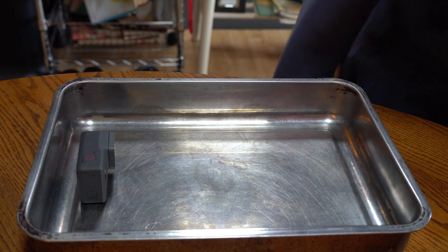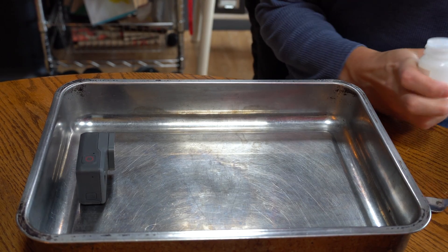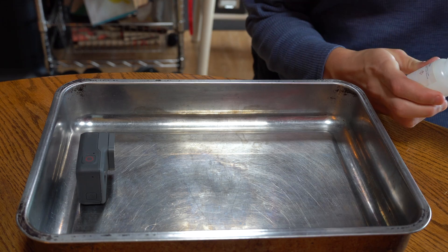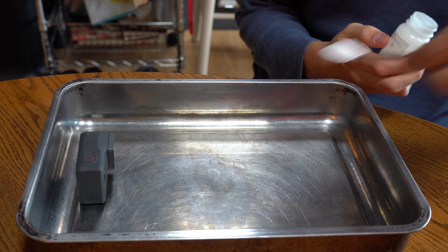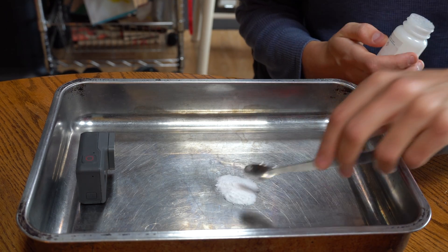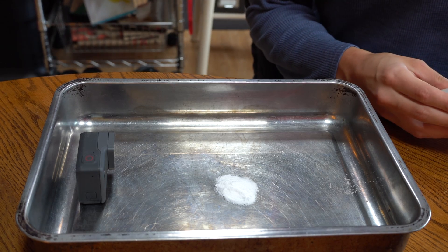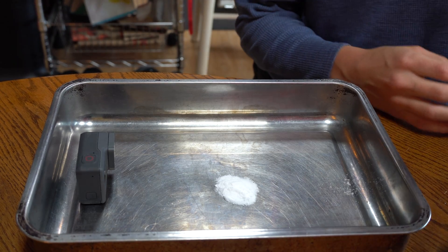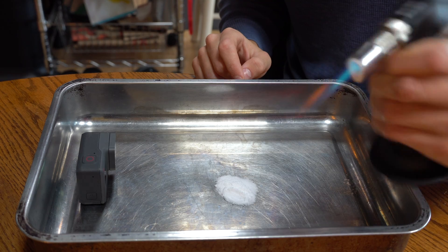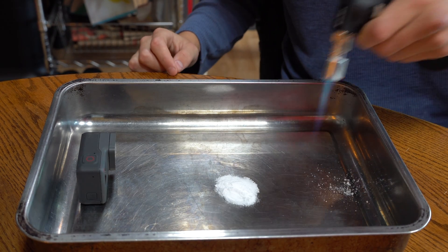As I was saying, the first thing we're gonna do is scoop out some pure lithium chloride — LiCl is the chemical formula for it. So what we're gonna do is light this thing. Let's do it. I hope things don't go too crazy.